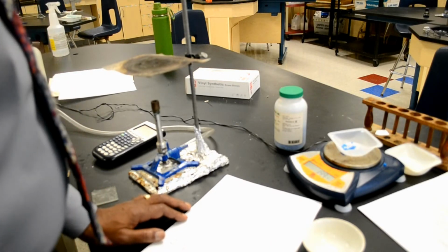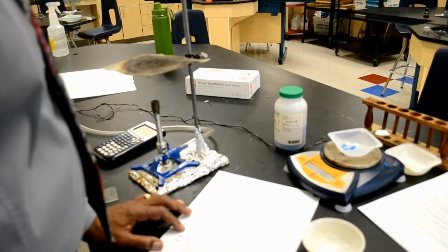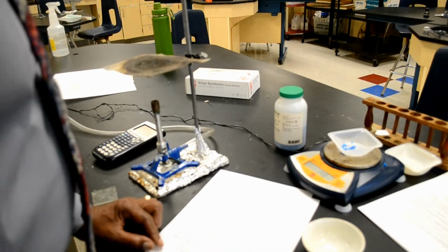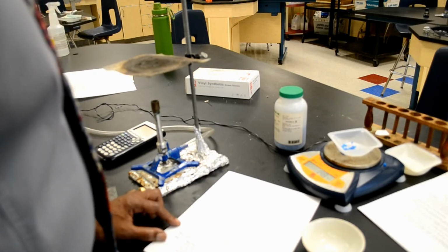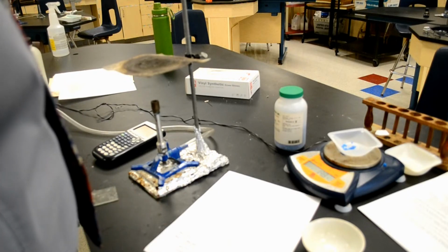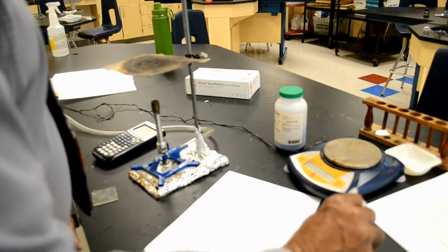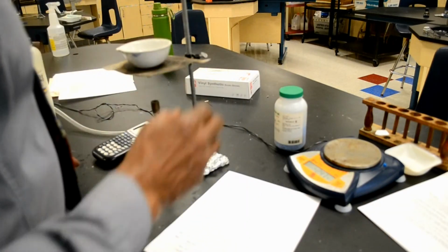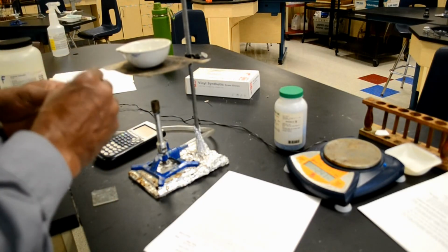All right. Then it says record the mass of the hydrate as mass B. All right, so the mass is mass B, 1.99 grams. Number 4, carefully add the copper sulfate hydrate to the evaporating dish on the hot plate. Well, the evaporating dish was there. I'm just going to place that back up there and light the burner again.